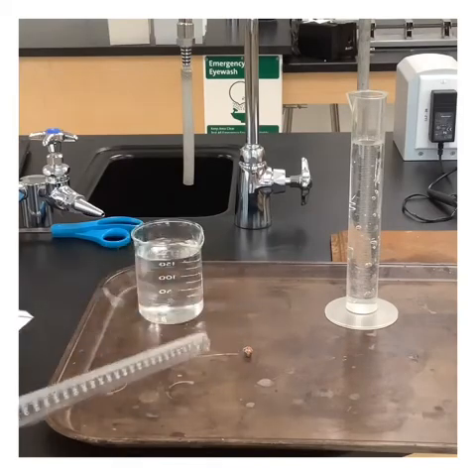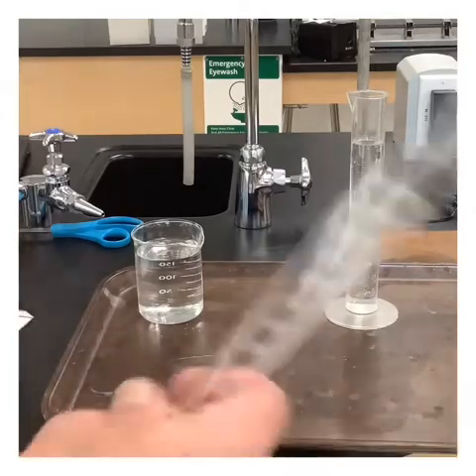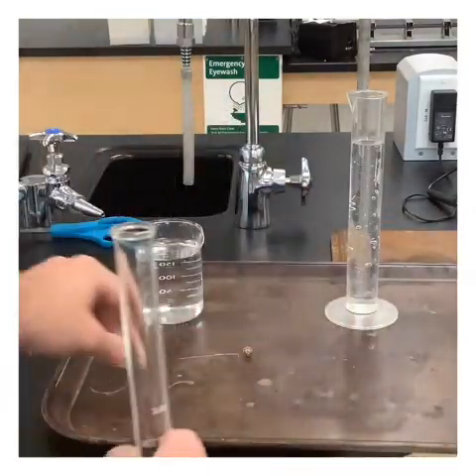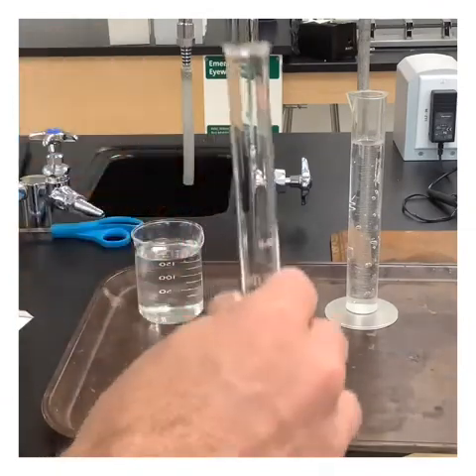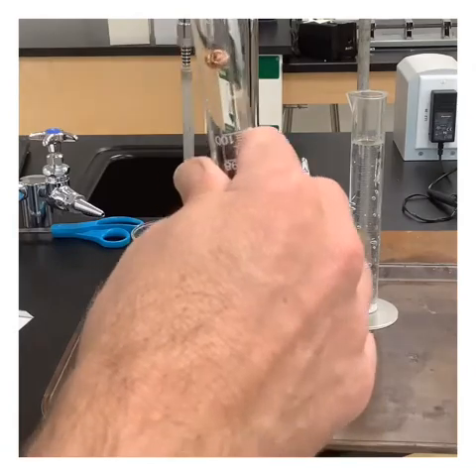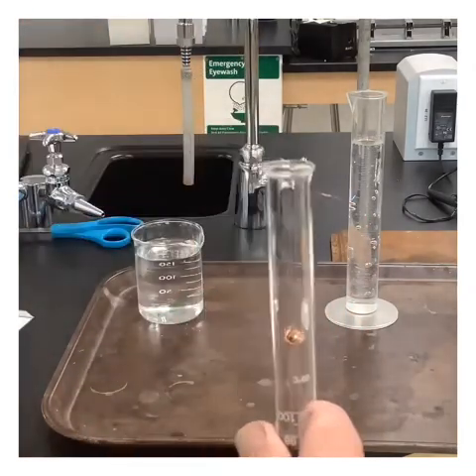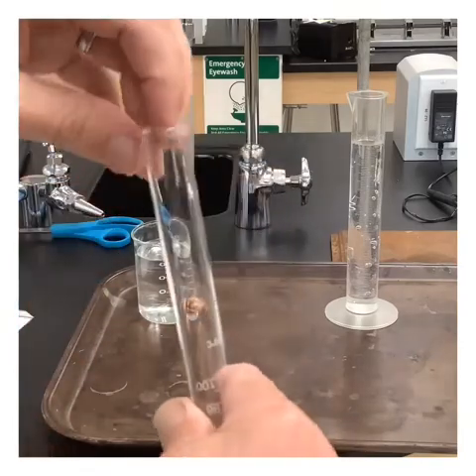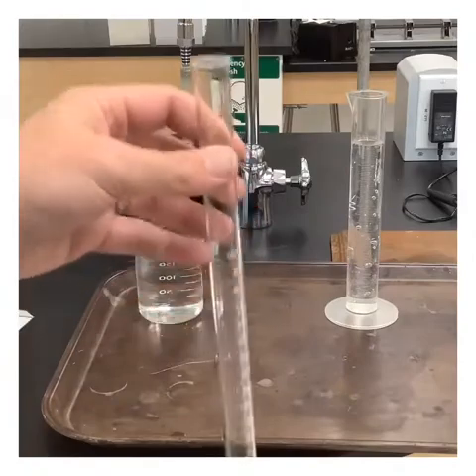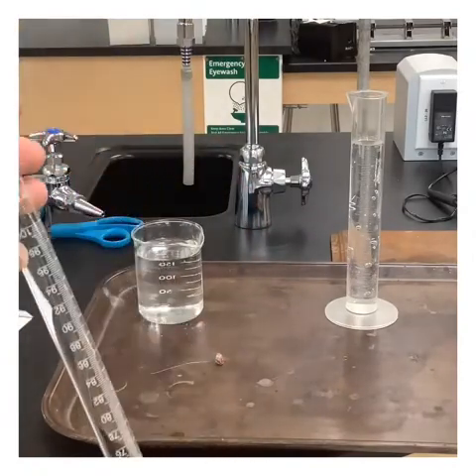So what I'm going to do is mix the acid in here. Now, if I just filled it with acid to the top, the second I put this inside like that, it would start reacting with the acid and it would fizz out, and I would lose some of my gas. So the trick is to understand density.